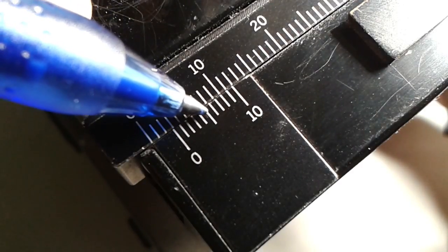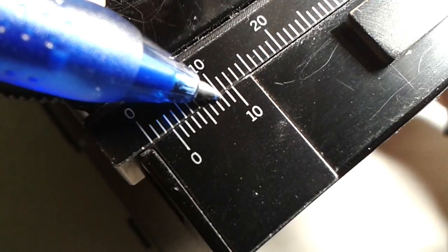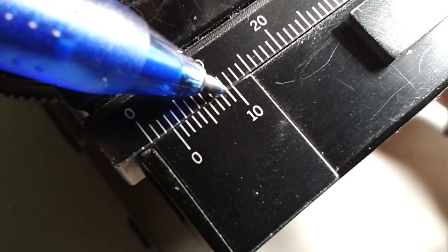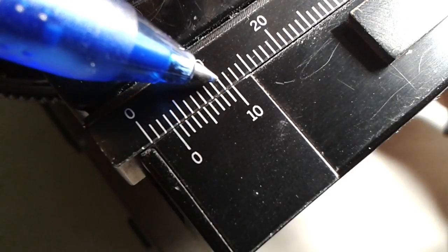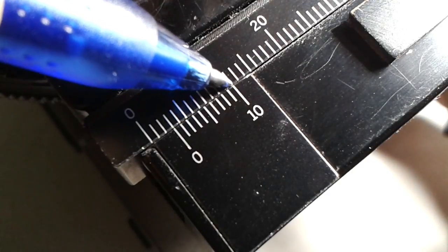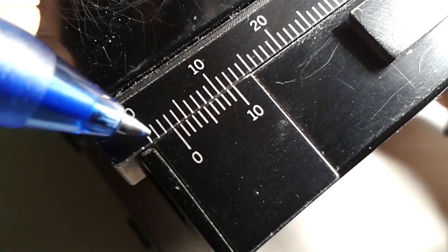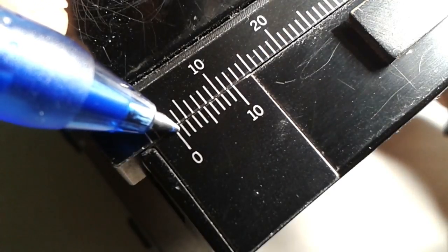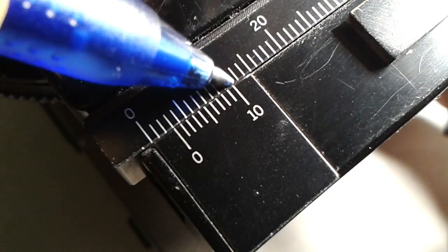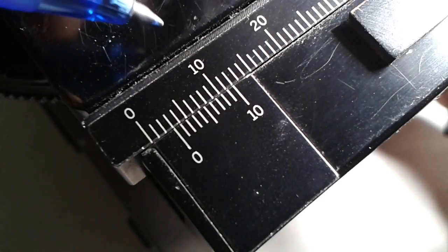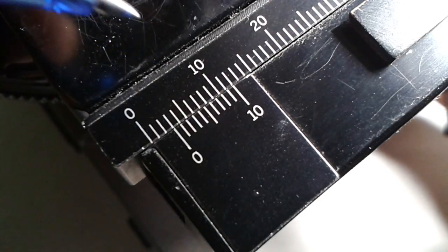That's actually quite nice because this stage caliper gives you a possibility to get a precision of a tenth of a millimeter. And then now that's at three. So that's basically at the third millimeter, it's at zero and the tenth small line is also lined up now. So that is 3.0 millimeters.